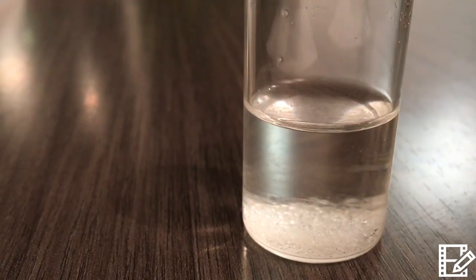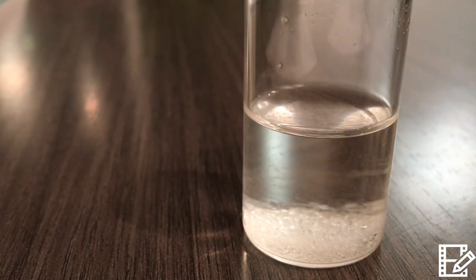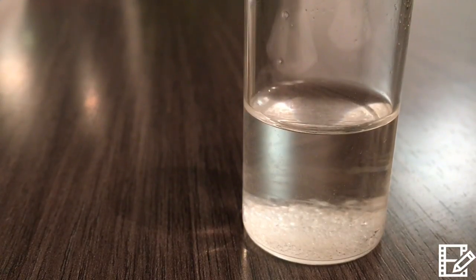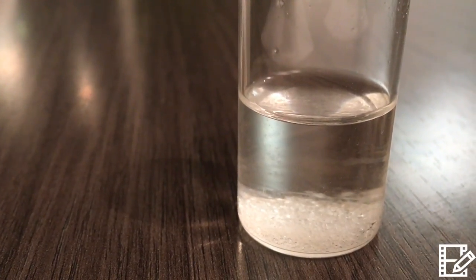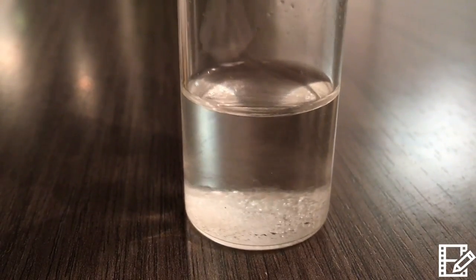There have been no drastic environmental changes to my crystals since my last video because it has remained unmoved in my dorm room. If anything, however, the increased amount of sunlight in my room and the open window on the recent nice days have caused a slight increase in my dorm room's temperature and humidity. These factors could affect the evaporation rate of the solution.